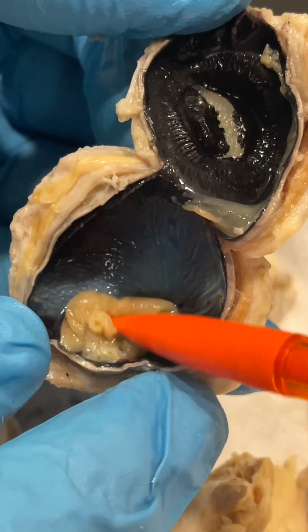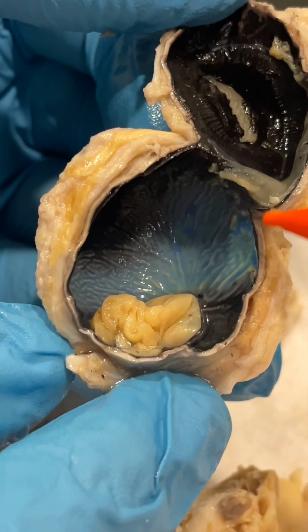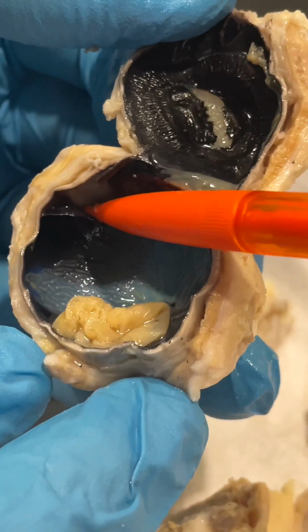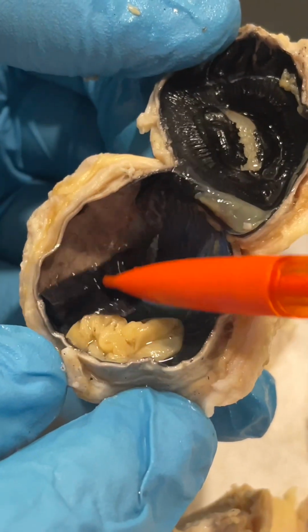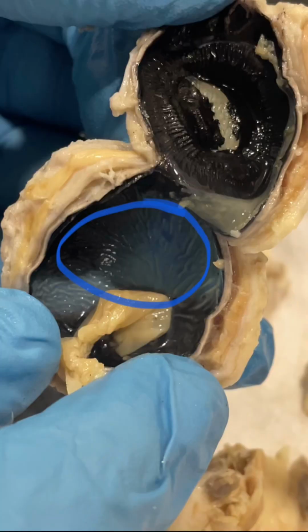This here, this colorful stuff, is the choroid layer. And if you pull this down, you see the white area right there? This is the sclera. The choroid is the middle layer of the tissue in the wall of the eye. It's found between the sclera and the retina. This thin layer of tissue is made up almost entirely of blood vessels. These blood vessels supply oxygen and nutrition to the outer part of the retina. In short, the choroid is the life source that keeps the retina healthy and functioning.